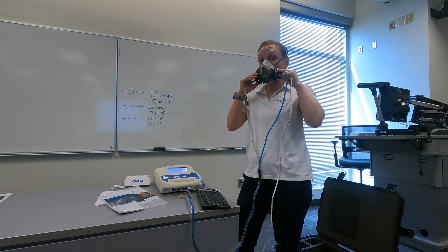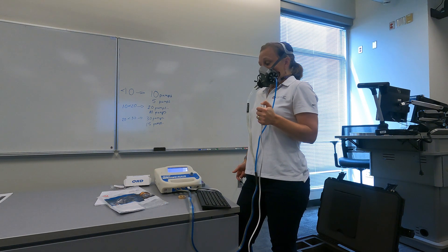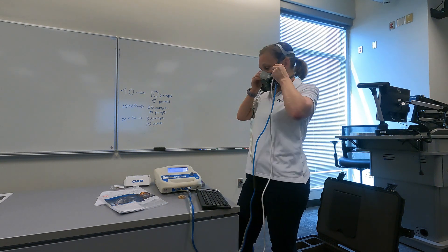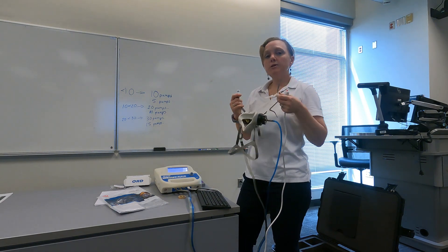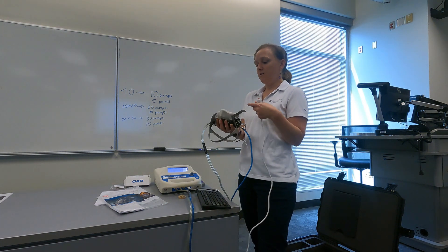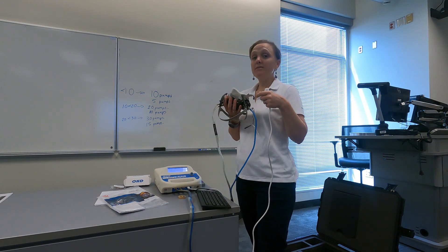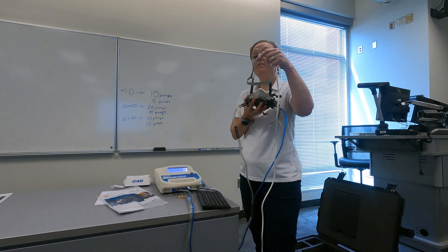Now that I have my respirator back on, I'm going to take a deep breath and hold the button. I passed. Now I'm going to redon the mask again. The point of the redon method is to show that I can effectively take the mask off and, when I put it back on, get a good seal again. Each time I put the mask on, I have it seated, take a deep breath in, and hold my breath while I hold the button down. I'm going to do that now — this is the last test.